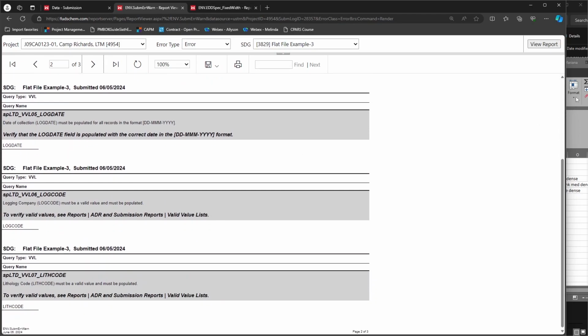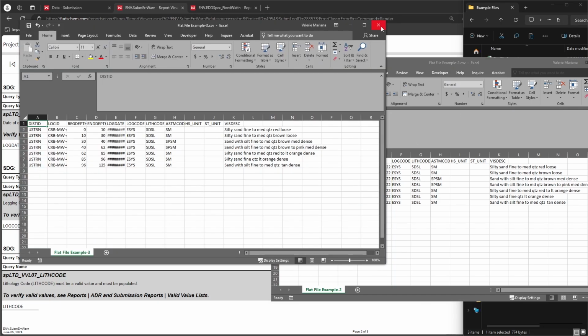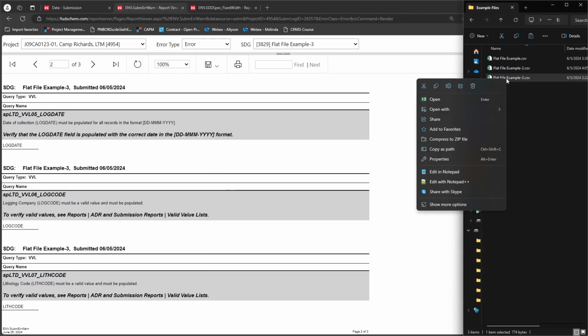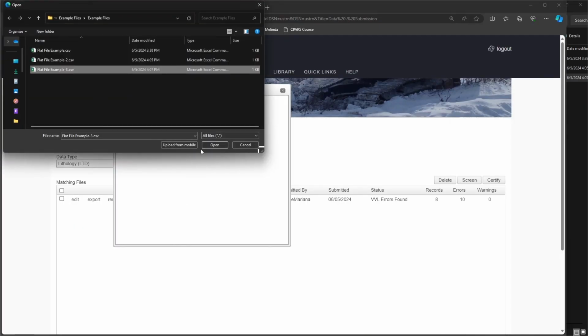If we open the file in Excel, it's not immediately obvious what the issue is. However, opening it in Notepad makes it easier to see. Let's right-click the file name and choose to open it with Notepad. CSV stands for comma-separated values. CSV files can be opened in Notepad and will show commas separating the values from each column. In Notepad, it is easy to see that we have a blank row consisting only of commas. We could delete this row in Notepad and save as a CSV file, or delete the row in Excel. If we removed it in Excel, we would need to reformat the dates, which is not an issue in Notepad. Let's remove the empty row and save the file. Let's re-upload our file and screen it. We've successfully resolved our errors and the file is ready to certify.